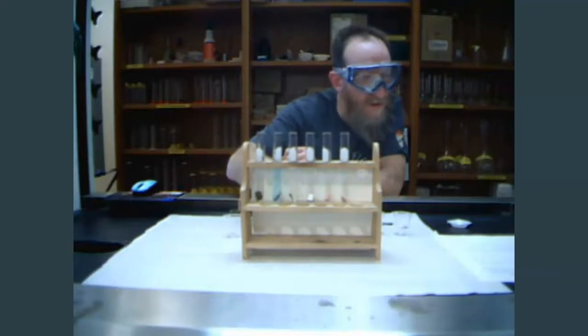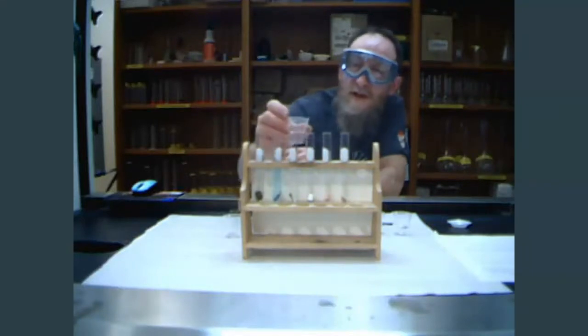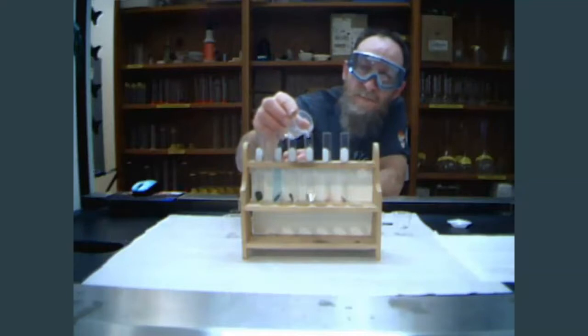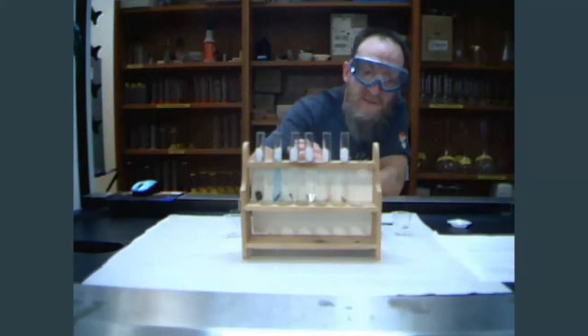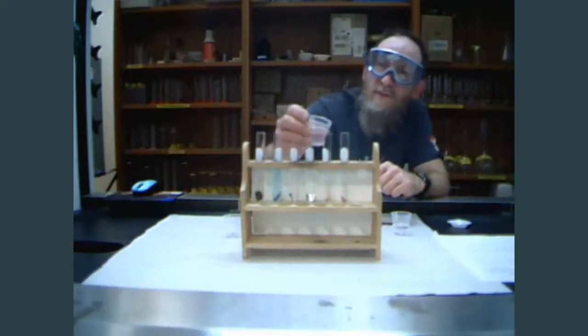To the fourth test tube there, I have some magnesium sulfate, commonly known as epsom salt. And we have some sulfuric acid with copper.